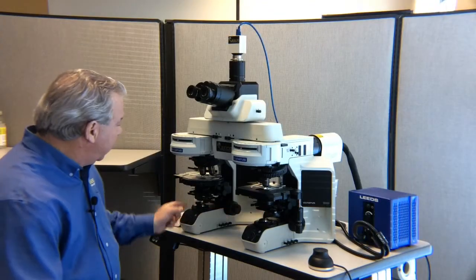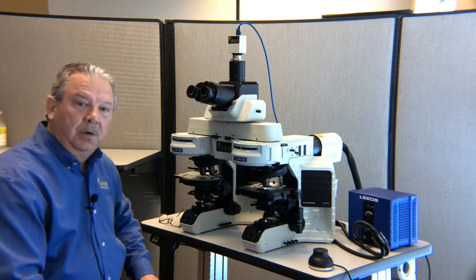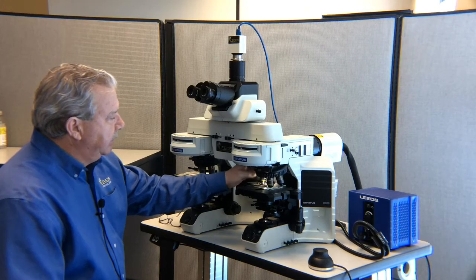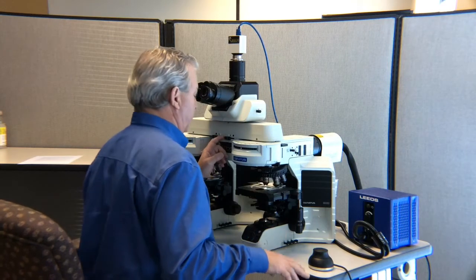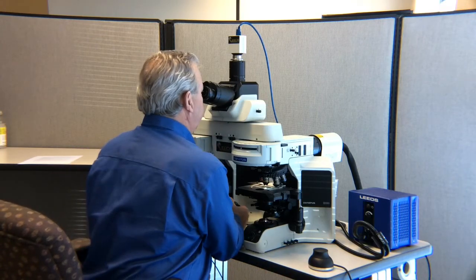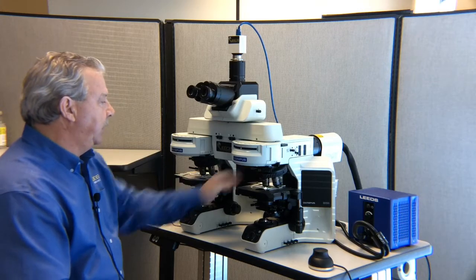With both of our polarizers out of the ray path, our aperture diaphragms wide open, and our top element flipped in, we're going to load 2 samples onto the microscope, one on the right stage, one on the left stage. I'm going to start out focusing on these with one of my low power objectives. I've got the right hair, in this case it's a dog hair, in focus on the right side. I now look at the left side image and bring that into focus as well. Now what I want to do is work my way up to my highest magnification, which in this case is 40x.